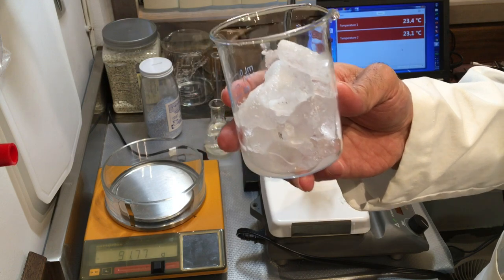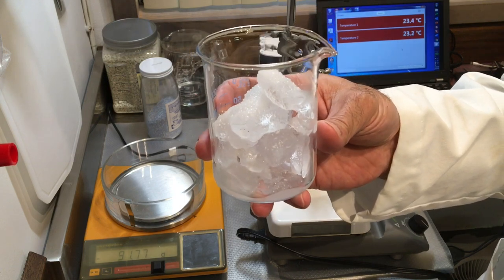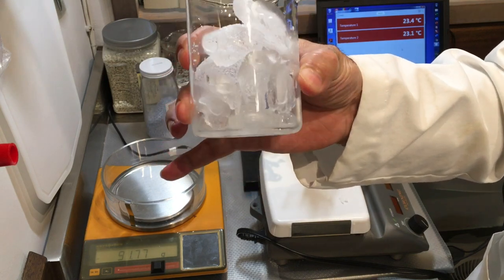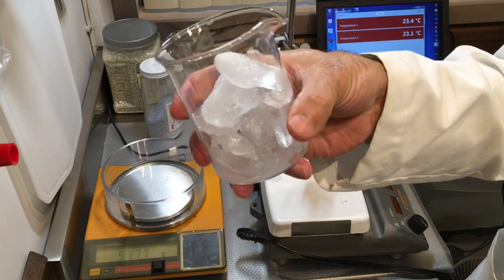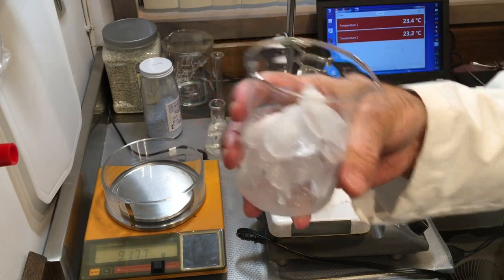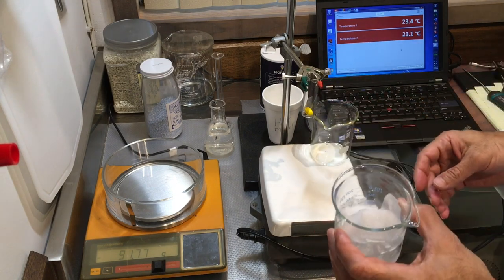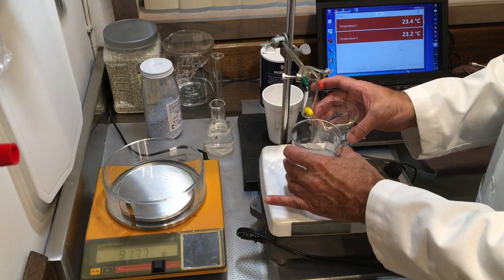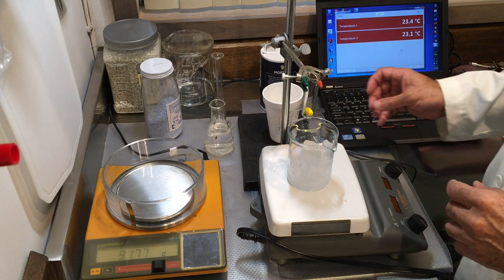They usually don't add sodium chloride — I think they add calcium chloride. Ionic salts do a good job. You can see there's a melted salt-water mixture forming and it's getting cold to touch. The temperature drops below the freezing point of water, which is zero degrees Celsius.